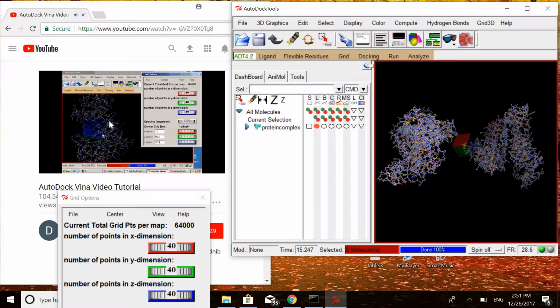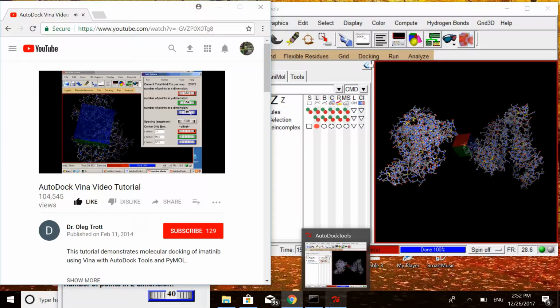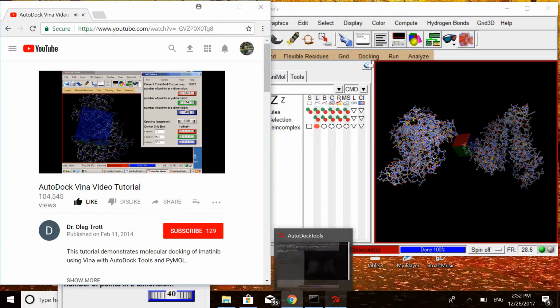We also have to choose the sizes of the search space. AutoDock Tools measures the sizes in points instead of angstroms. To convince it to use angstroms, we can set this dial to 1.0, which is a scaling factor. For the sizes, I will use the following values: 22 for X, 24 for Y, and 28 for Z.